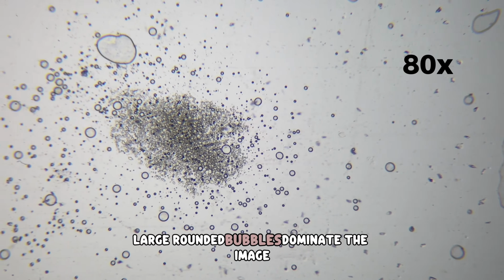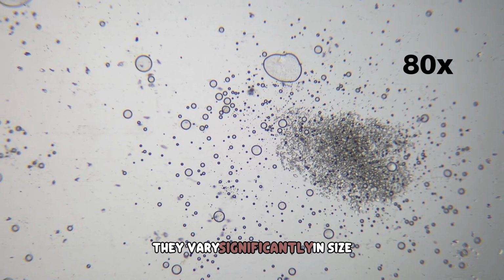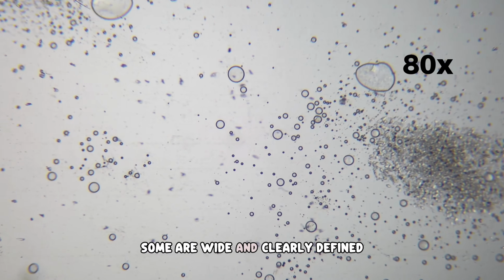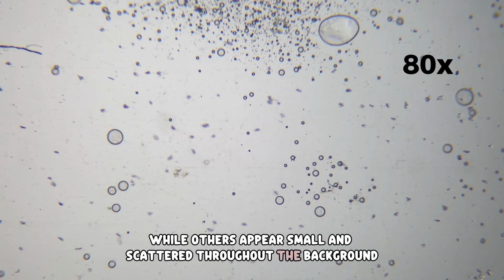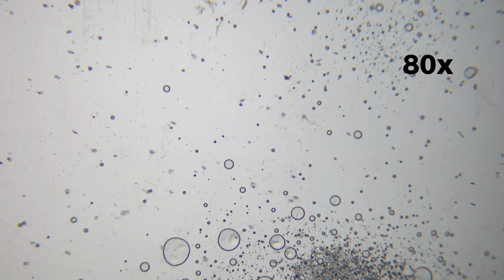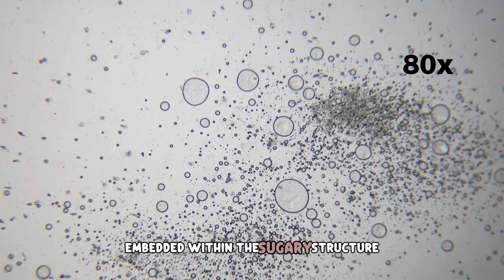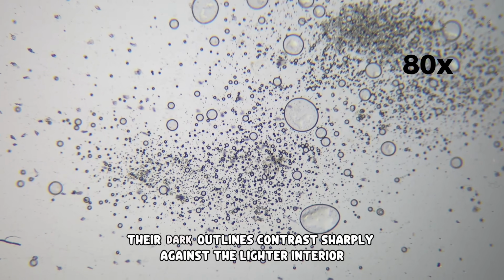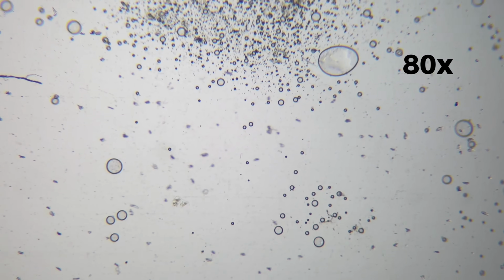Large rounded bubbles dominate the image. They vary significantly in size. Some are wide and clearly defined, while others appear small and scattered throughout the background. These circles represent trapped air pockets embedded within the sugary structure. Their dark outlines contrast sharply against the lighter interior.